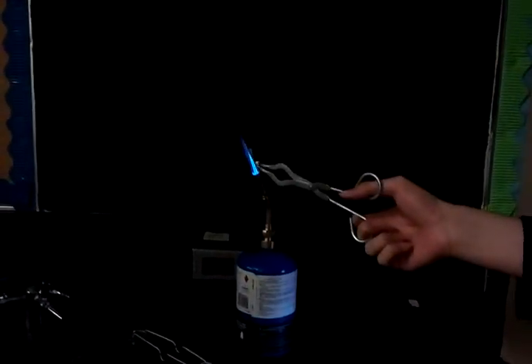You bums. All right. And now, we take the tongs, hold the magnesium, light it on fire.